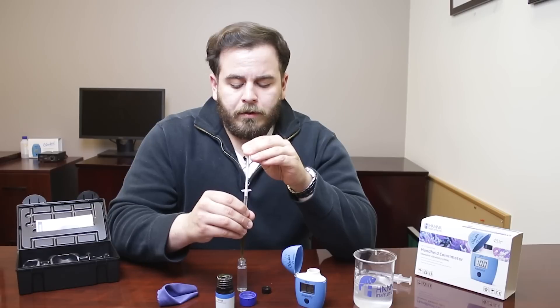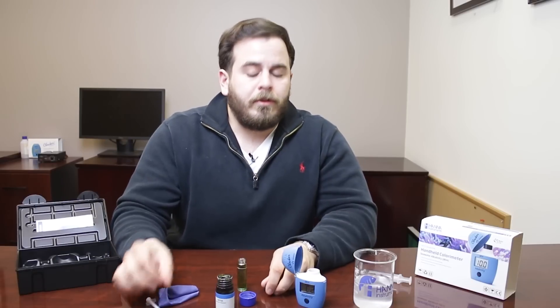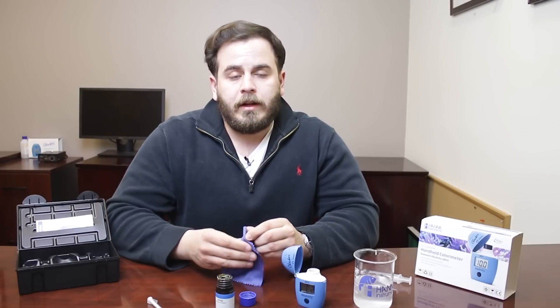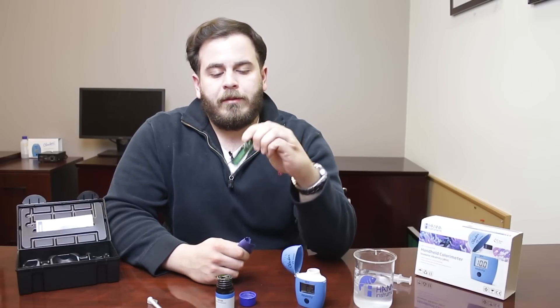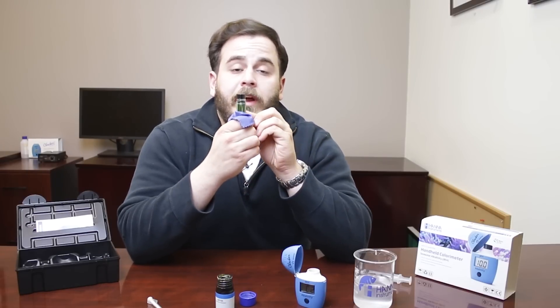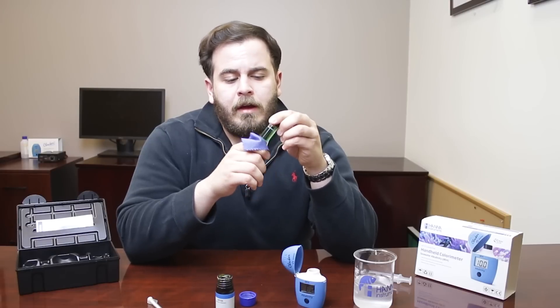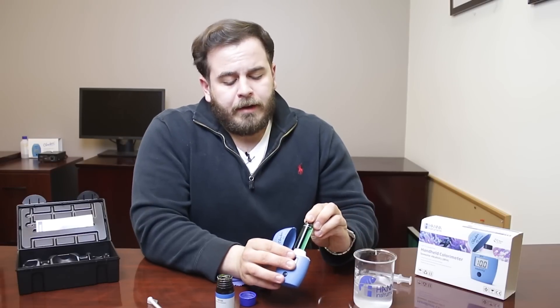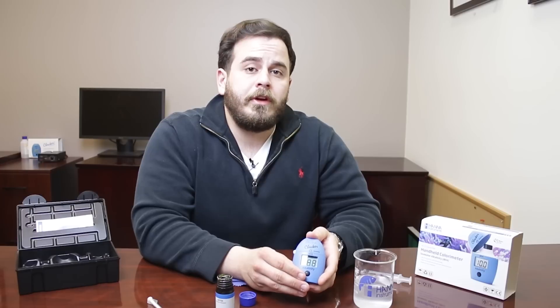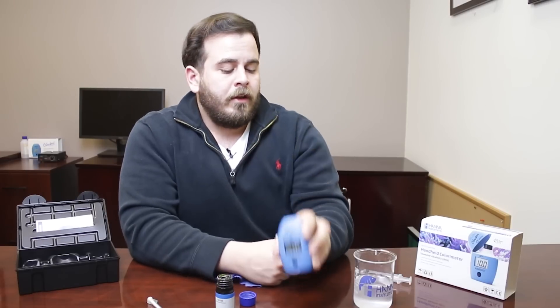Administer one milliliter of liquid reagent to the saltwater sample. This test always uses the same amounts — 10 milliliters of tank water and one milliliter of liquid alkalinity reagent, with no drops to count and no colors to match. Invert the cuvette gently three to five times. Since these are optical-based measurements, make sure the outside stays clear and there are no air bubbles on the inside, as bubbles can cause the light to refract. Insert the cuvette again with the 10-millimeter marker forward, close the hood, and press the button. The checker will read the color change and display the result — in this case, 8.8 dKH, which is right in the range we want.